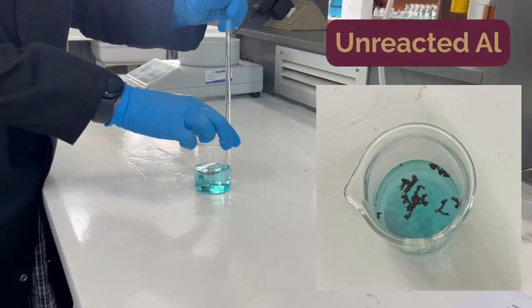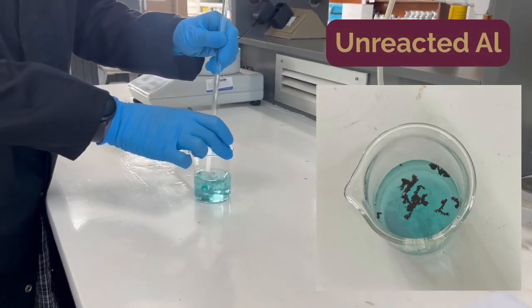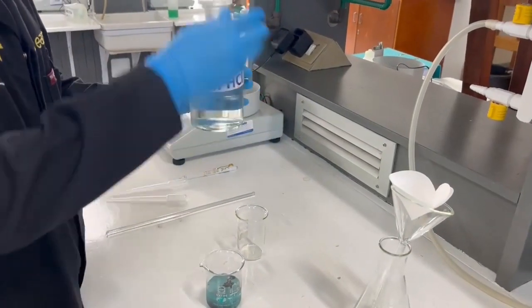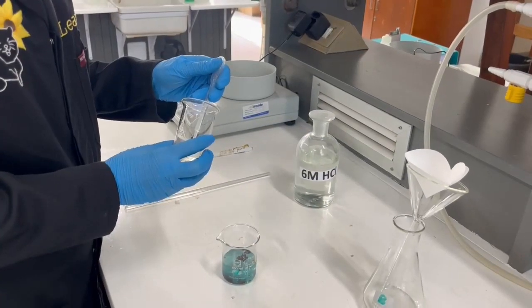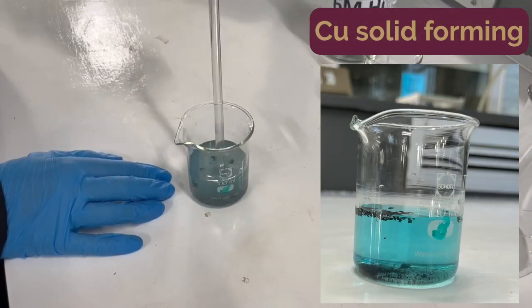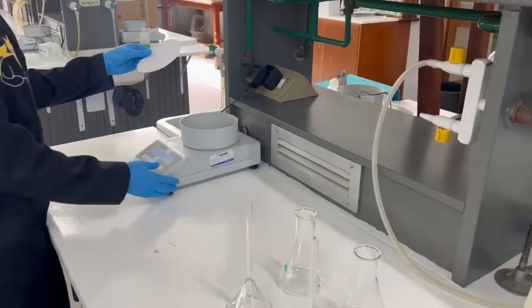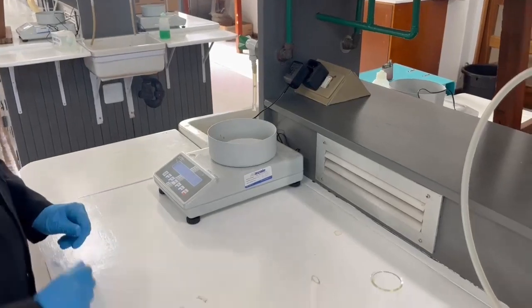If there's excess aluminium shavings still observed in any of the beakers after 20 minutes, then add about 5 to 10 cubic centimeters of 6 molar hydrochloric acid. Hydrochloric acid is corrosive, so handle with care. Add approximately 1 cubic centimeter portions and stir with your glass rod until all of the aluminium shavings are no longer visible. Weigh the two filter papers provided and record the exact masses in the data report table.